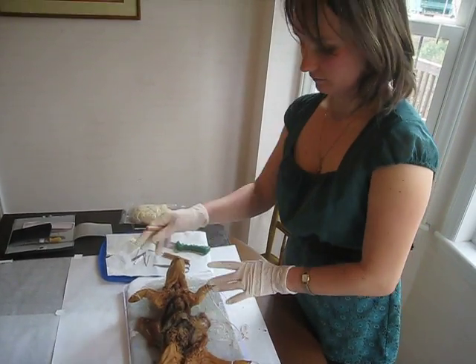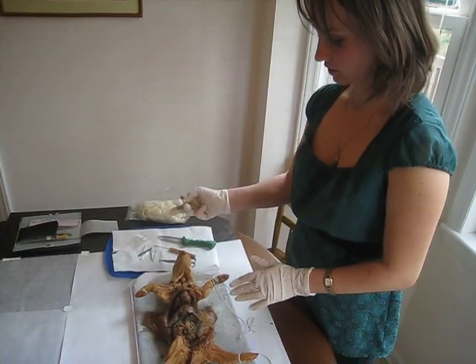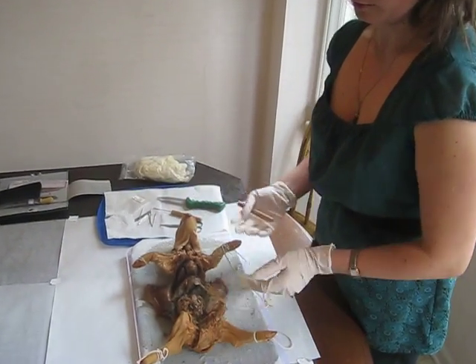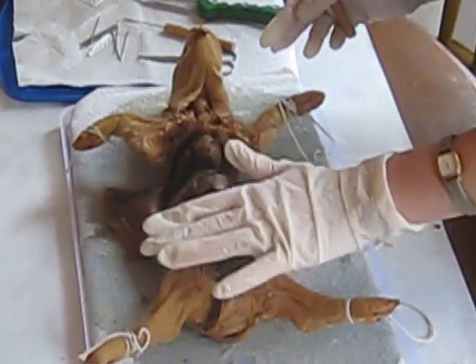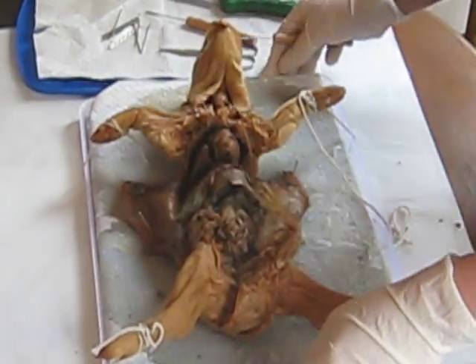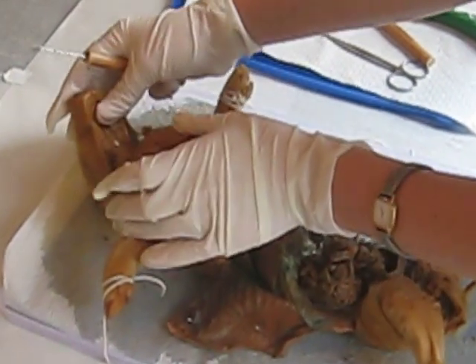So I've already secured the pig and I've already dissected it, so let me go ahead and show you. This is the anterior of the pig and this is the posterior, and the pig is lying on its dorsal side and it's facing me with its ventral or belly side. So first, let me show you the oral cavity right over here.